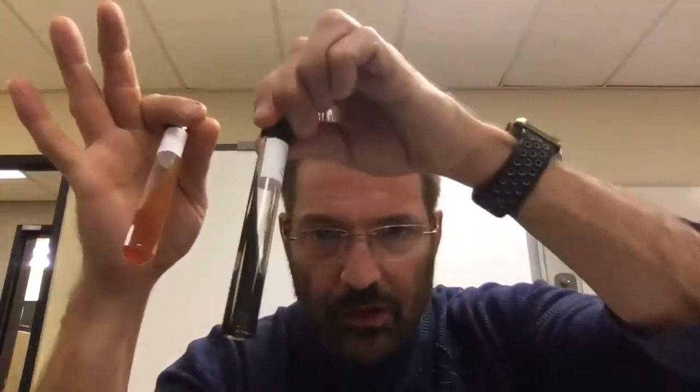This isn't going to be sterile now. Okay, you need to smell that. It's like rotten egg. Smells like a bad perm. Not that there's ever a good perm. But that's the color change. So, like from your lab sheet, remember if it's dark, hydrogen sulfide is produced. That's going to be indicative. There's only a few that will do that, right?